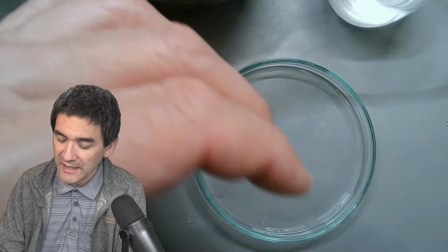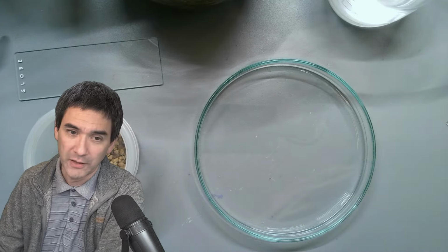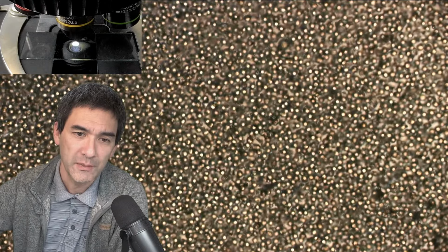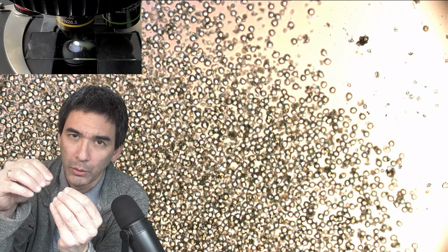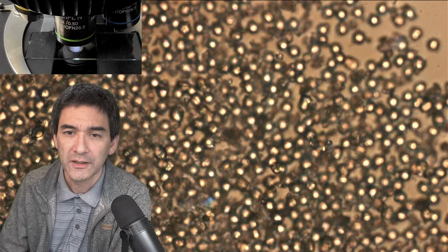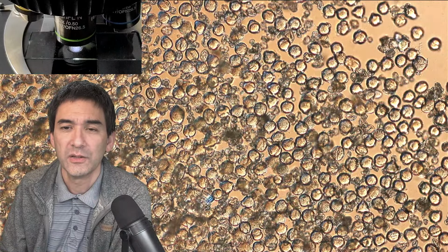I'm going to show you in any case a lot of pollen, just a slide with pollen without a cover glass even. My hope was to see the germination, but unfortunately this did not work. What I have to try now is, since it's springtime in Central Europe where I'm living, there are going to be more and more plants with pollen right now. You see all of those little circles here, these are all pollen. When you add the sugar solution, they should start to grow a so-called pollen tube. I was unfortunately not able to see that. The pollen are essentially still as they used to be.